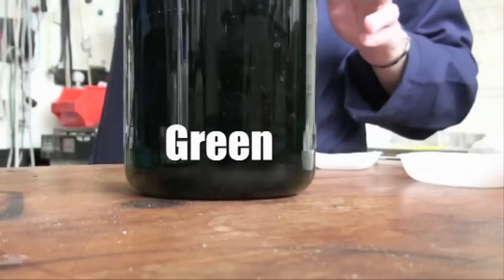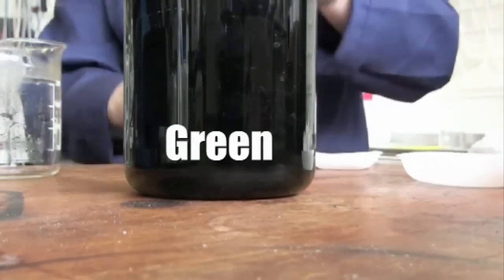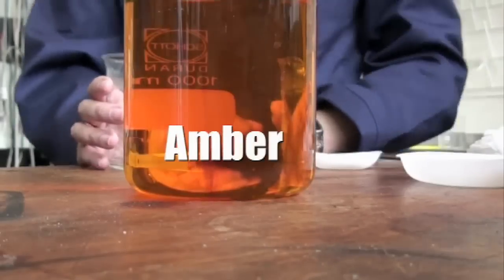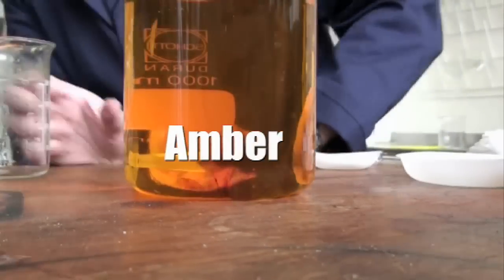This reaction actually has a name, it's called traffic lights. I do this at local primary schools when I visit them and show them this reaction. Hopefully you'll be as wowed with this as the kids are.